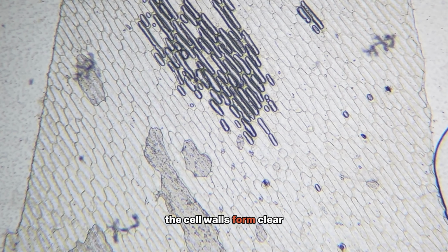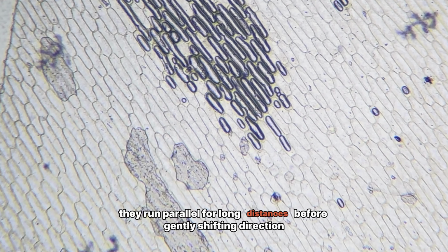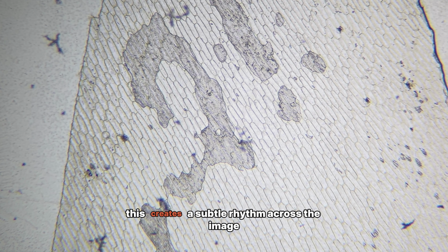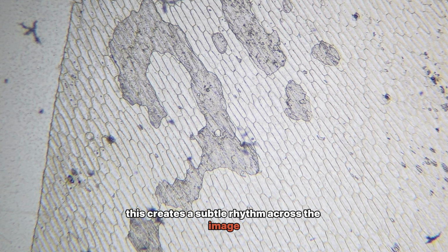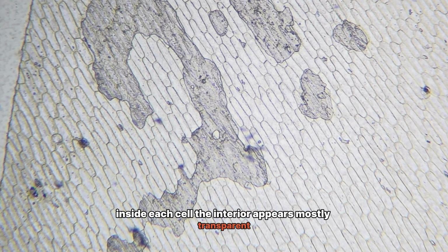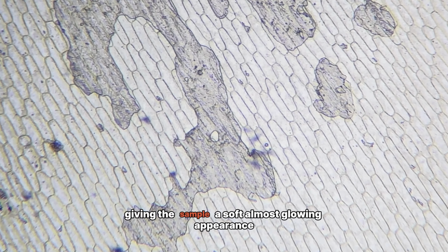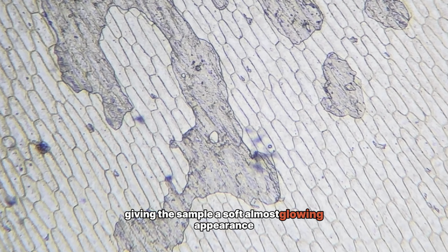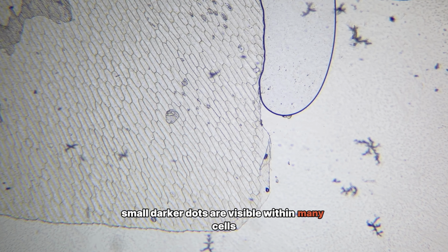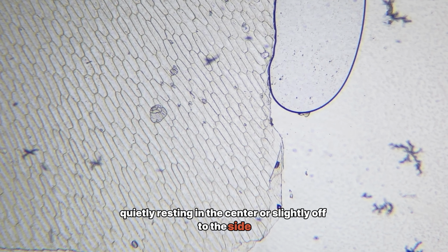The cell walls form clear, straight boundaries. They run parallel for long distances before gently shifting direction. This creates a subtle rhythm across the image. Inside each cell, the interior appears mostly transparent. Light passes through easily, giving the sample a soft, almost glowing appearance. Small, darker dots are visible within many cells, quietly resting in the center or slightly off to the side.